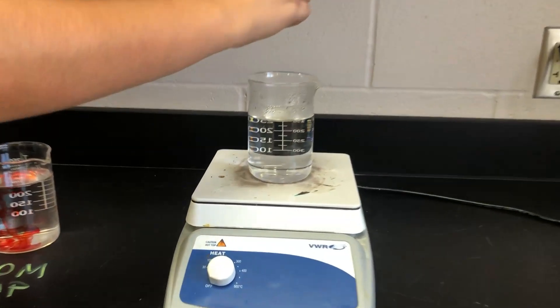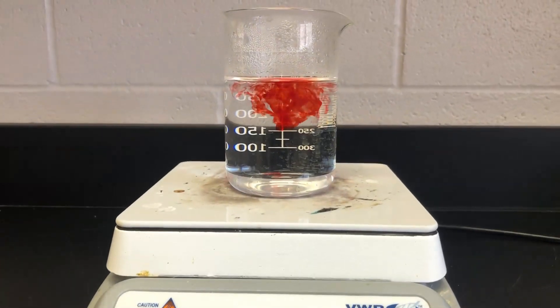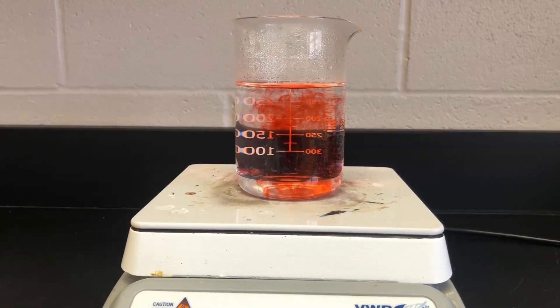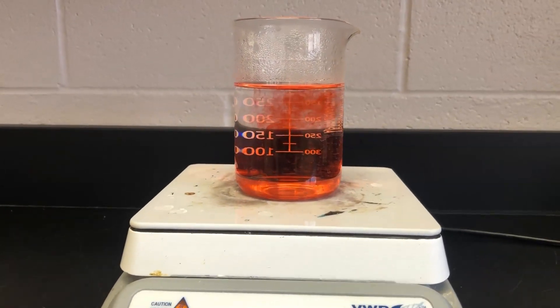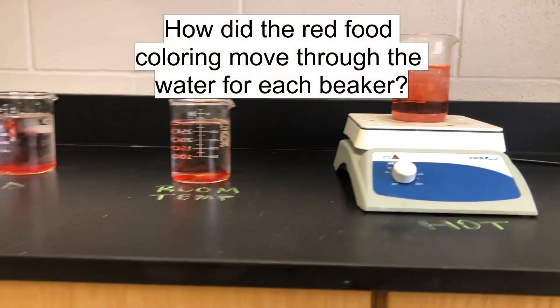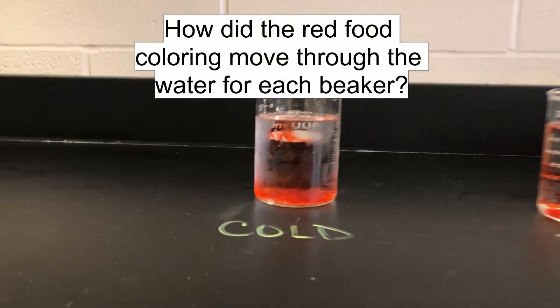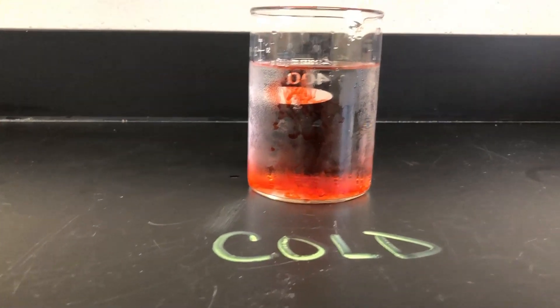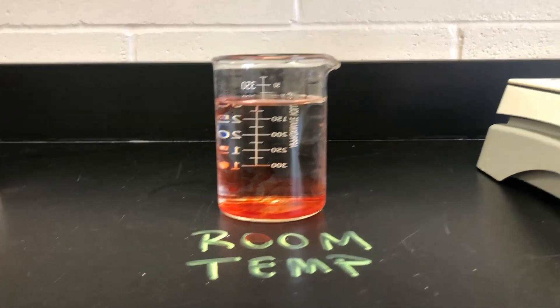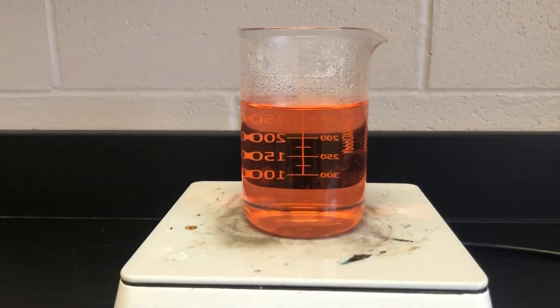And now hot. Now that we've had all three food colorants added, your teacher is going to go ahead and pause the video at this time so you can go ahead and record your observations and answer any questions pertaining to this station.